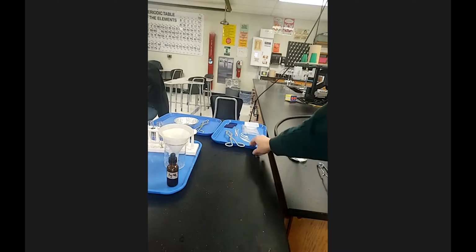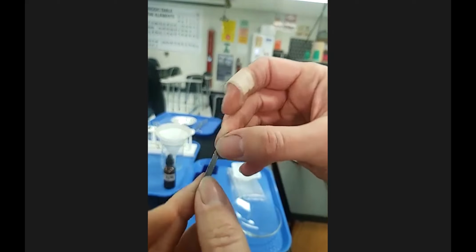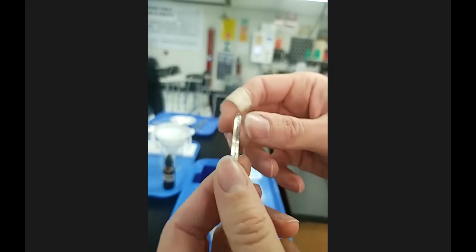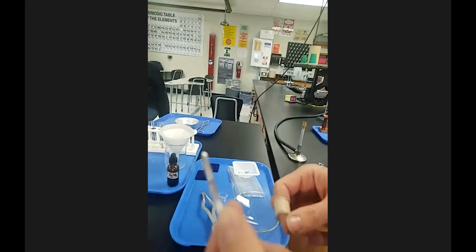Station 2 is taking a piece of magnesium metal. So here is the magnesium metal, and it's very bendy, shiny. It's a thin piece here, and it's not like super sharp, but it definitely has rough edges on it. And I'm going to light this in a Bunsen burner flame. Now, I'm going to do it a couple times. So let me light the Bunsen burner here.